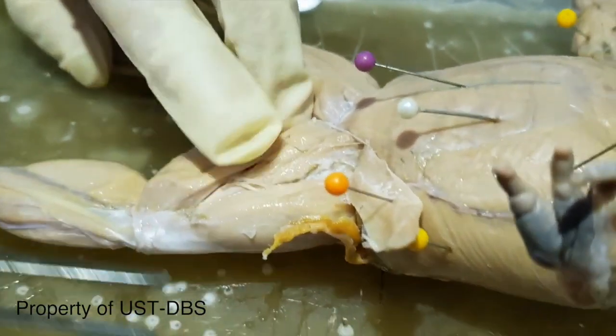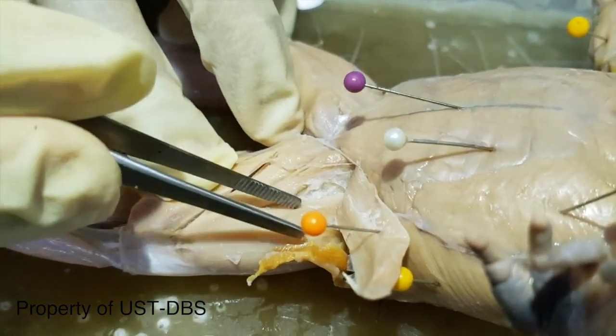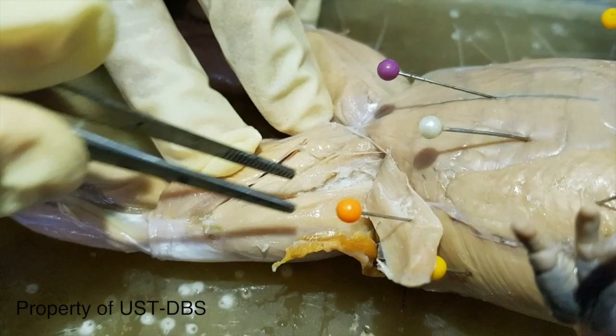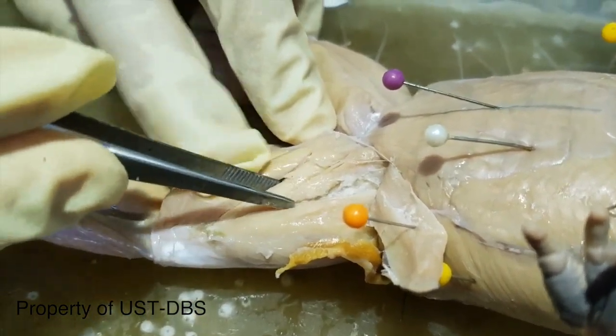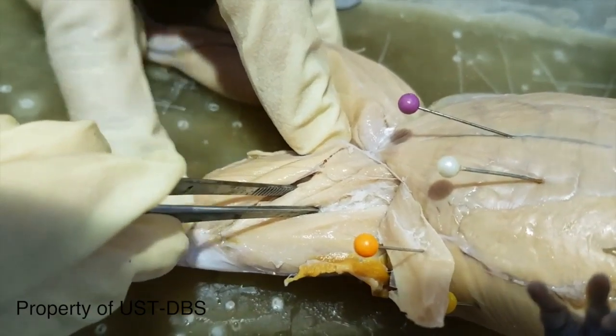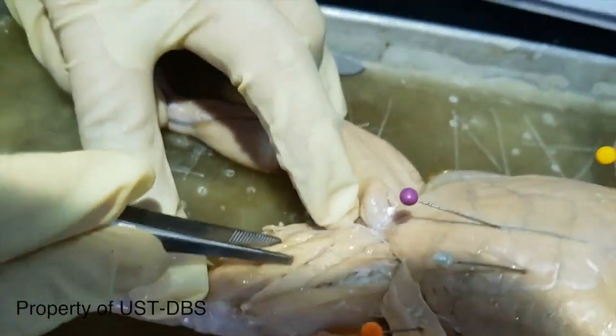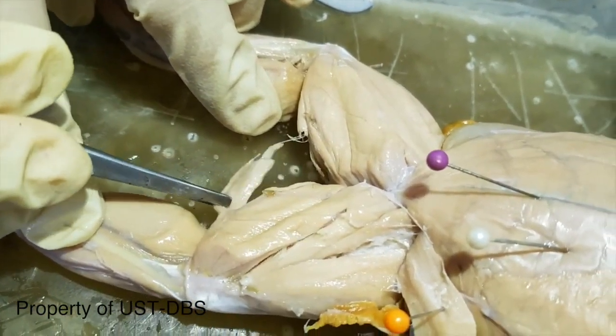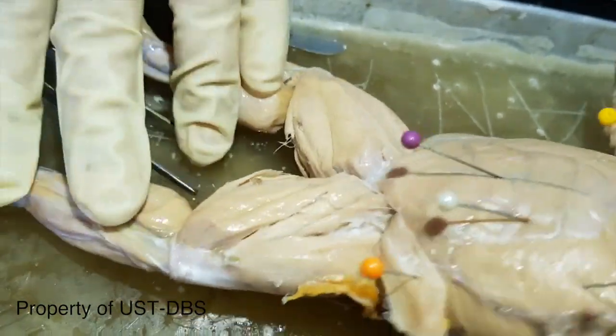Okay. So the underlying muscle now includes this big muscle here, the adductor longus. Longus because it's long. This is actually a bigger muscle also, the adductor magnus. Then this is the gracilis major, with the gracilis minor found on the inner thigh.